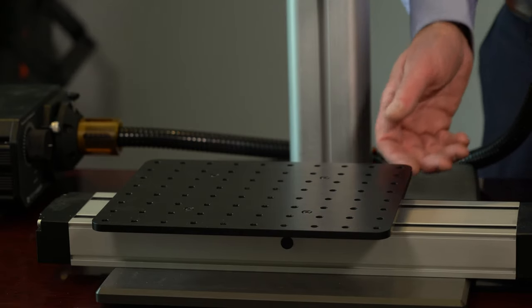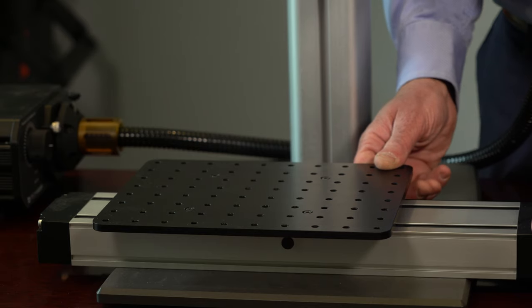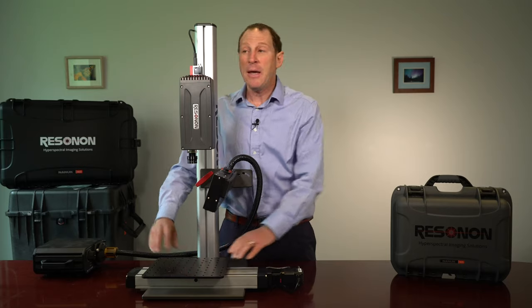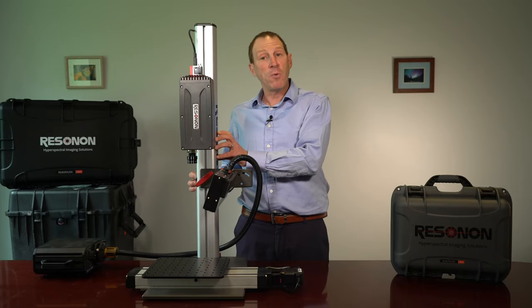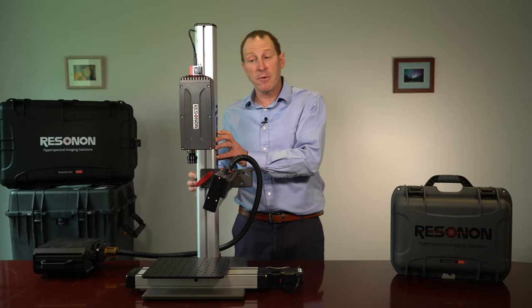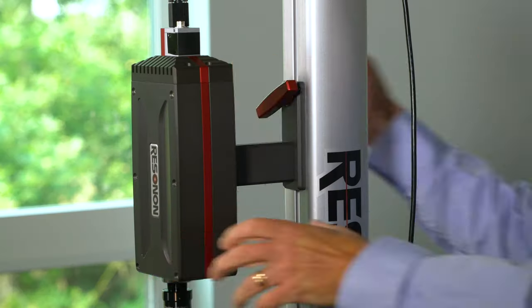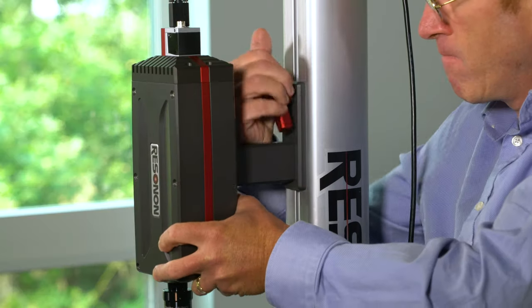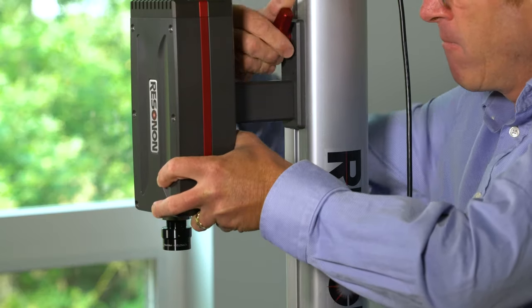This is a linear translation stage to hold the sample, and here is a mounting tower to hold everything together. The camera and lights are adjustable along the height of the tower.